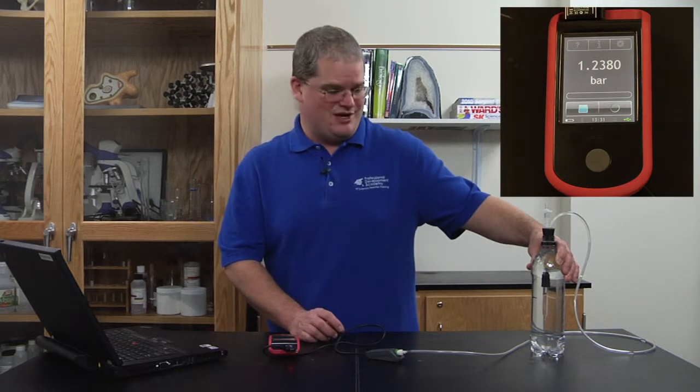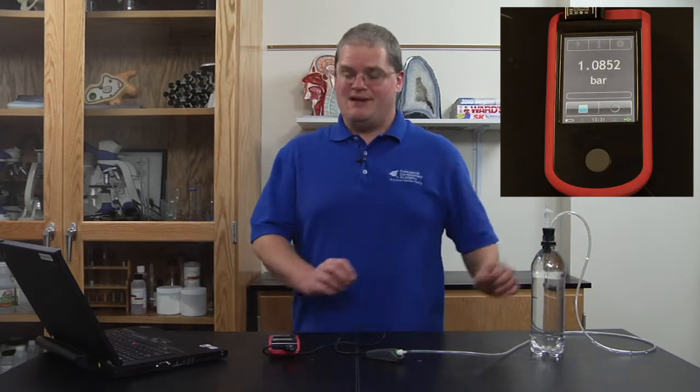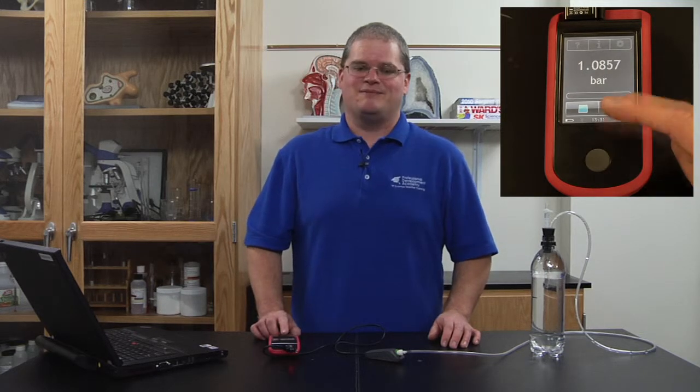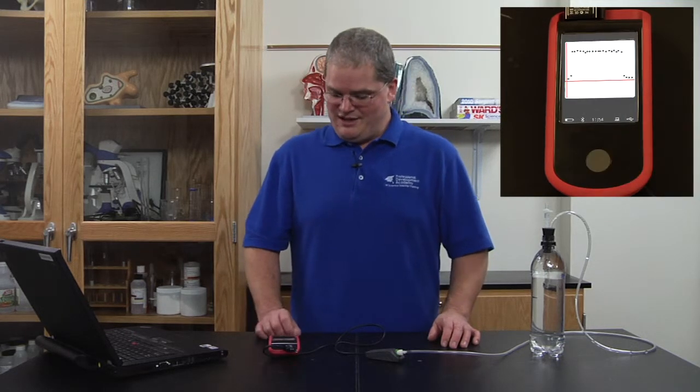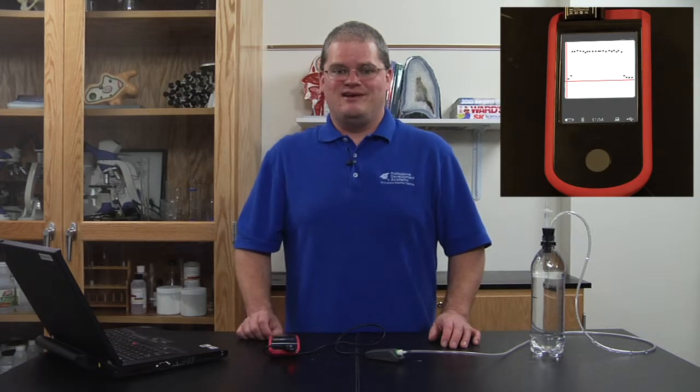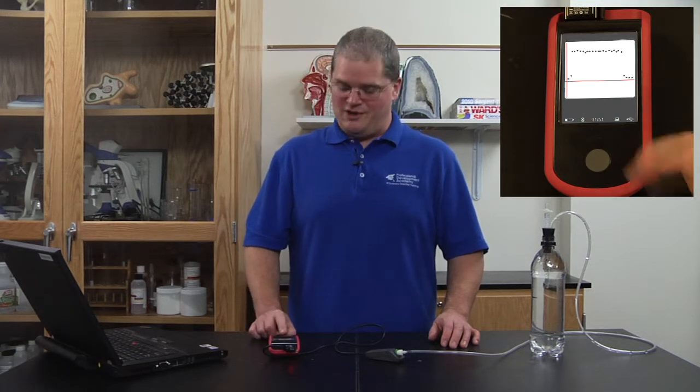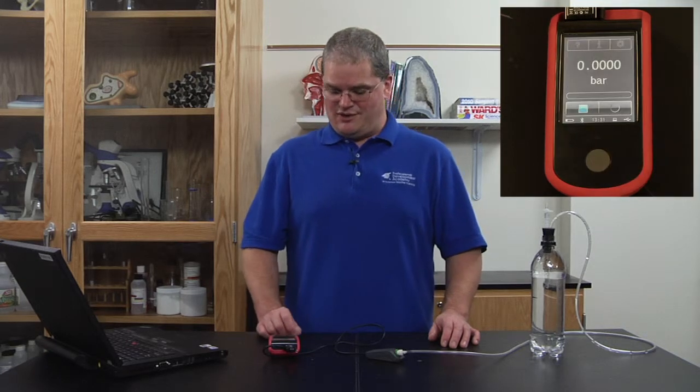Okay, that looks pretty good. Before I stop, I'd like to point out another feature. If you press the button at the bottom of the unit, you can get a graph that shows what has happened so far. If you push the button again, you return to your record screen.